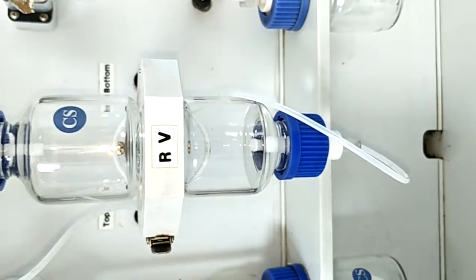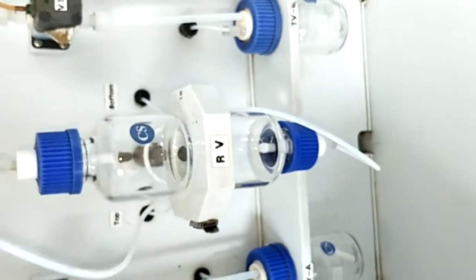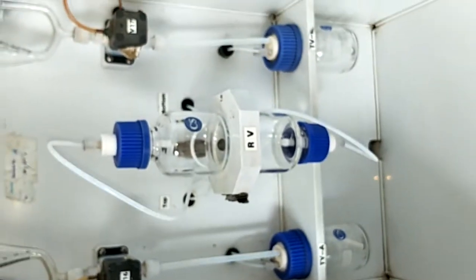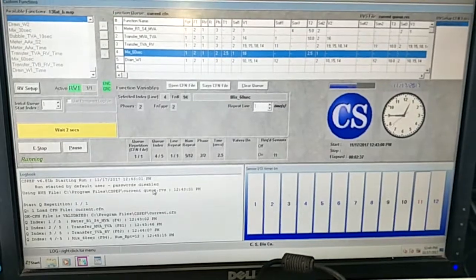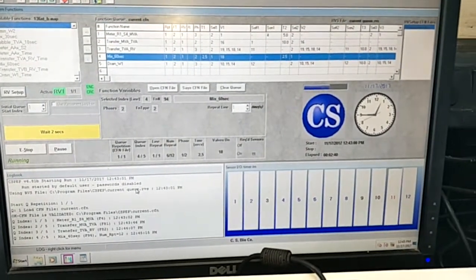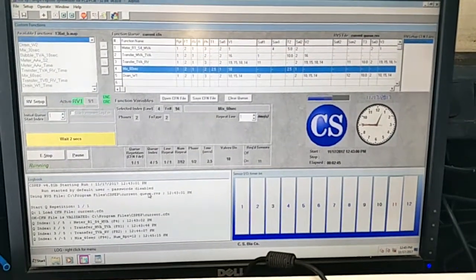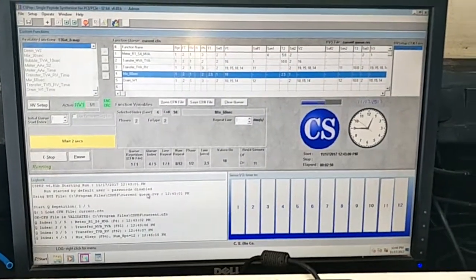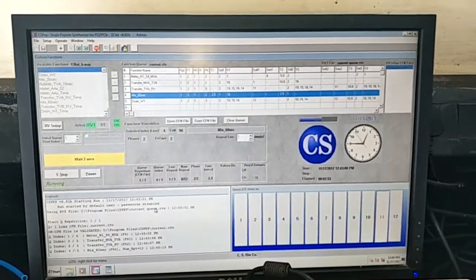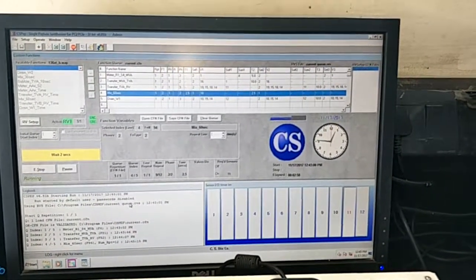Now it has changed to shaking, you can see. And now shaking started, and there is no shaking of the RV. It has come up to perform its function, but it did not work at all.